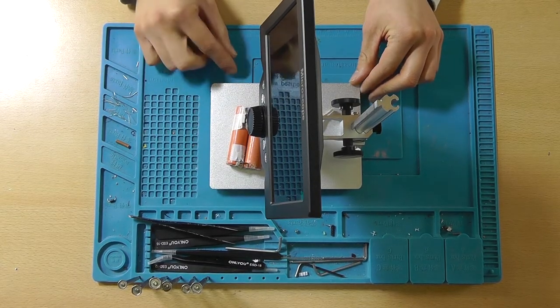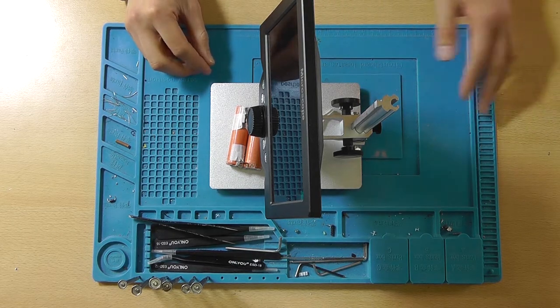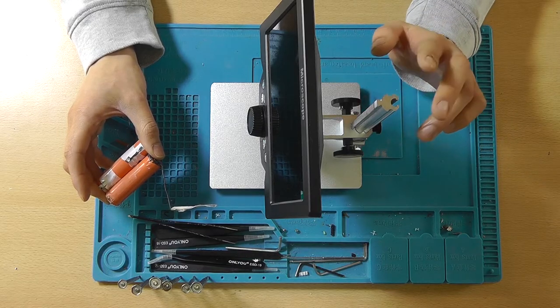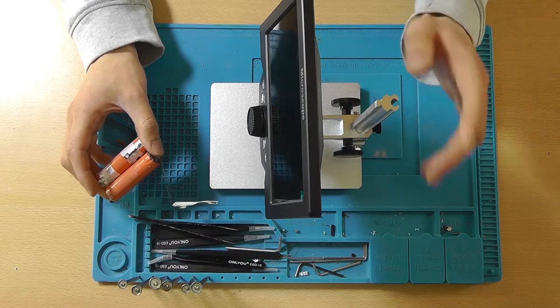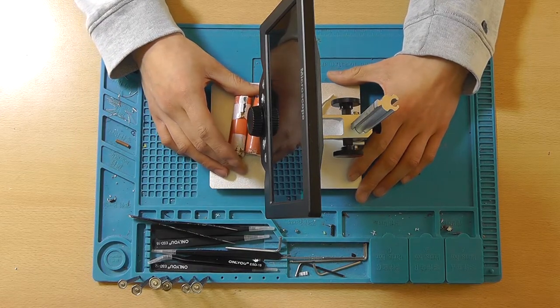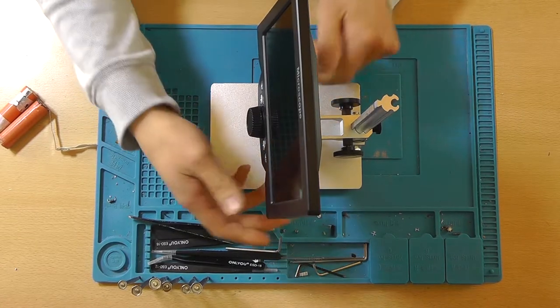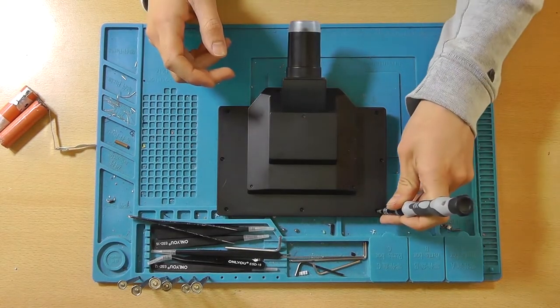But during editing, I came across the problem that the files got overwritten and they're not in the correct order. So I'm hoping that adding a battery to the microscope will actually keep the RTC powered on, so that the video footage, the properties of the video footage, contain the actual timestamp that they were created on. So that is the reason for opening this thing up and hopefully installing these batteries into it. So let's actually remove the microscope itself from the base here, and let's tear this thing apart.